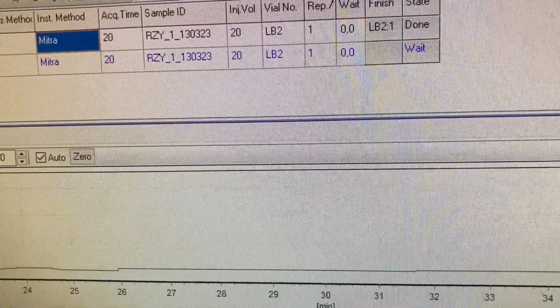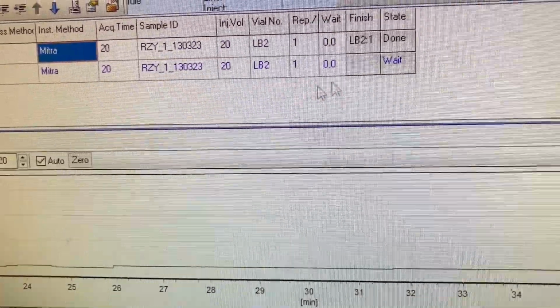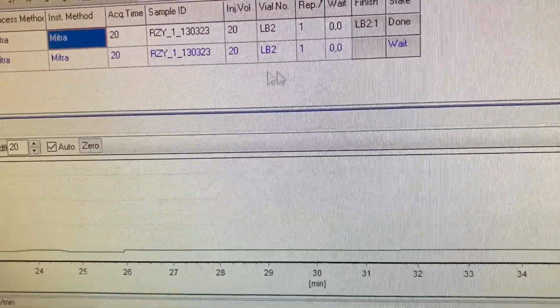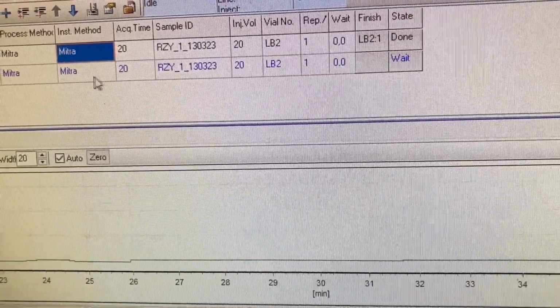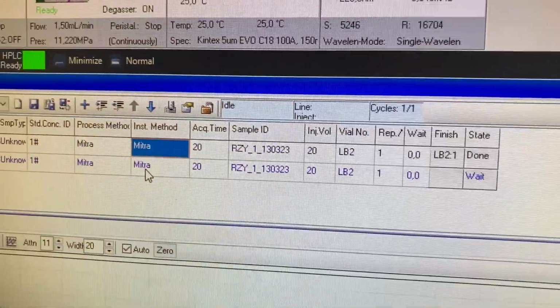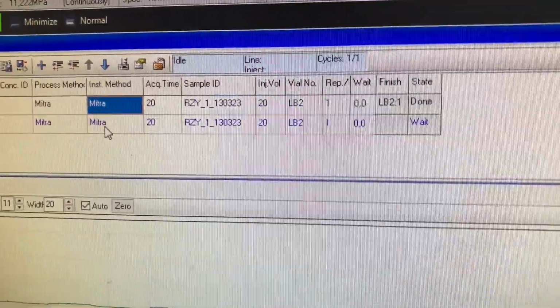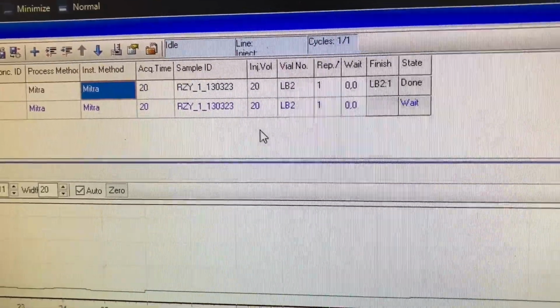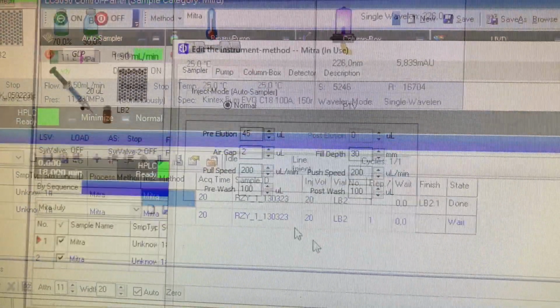It only actually needs to do the initial run to get a pretty accurate result. Otherwise, well, each run is 20 minutes. It doesn't really need to do the actual proper run, which is after the initial run, because that takes 40 minutes. If there's something wrong or it's not nice and stable, then maybe do 2 runs on the first one, and then the next vials just do the one 20-minute run, and it's going to be accurate, guarantee you, because I've tried many different things. It's very reliable.